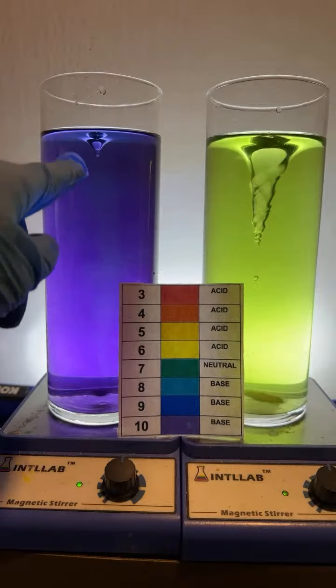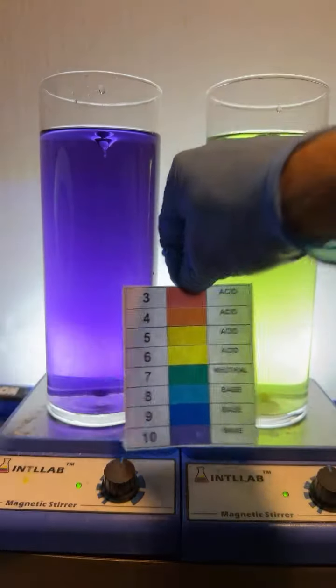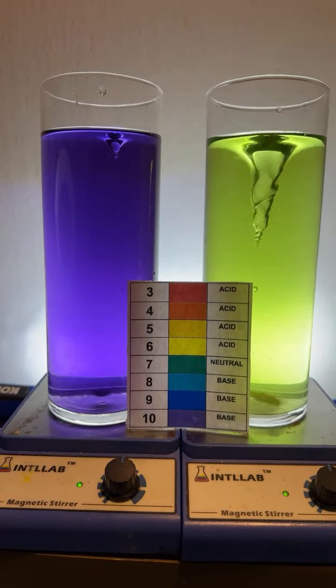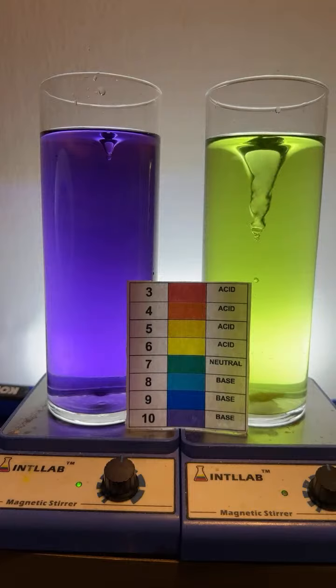Okay, I overshot. I mean, we're at like pH 10 now. Doggone it! I spilled a little bit on my diagram there. We're going to try to get blue. Blue's tough to get. Can I make antimatter from a banana? Come on, man. Let's see if we get a little blue color going on.